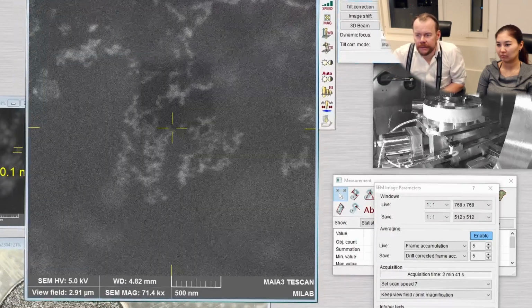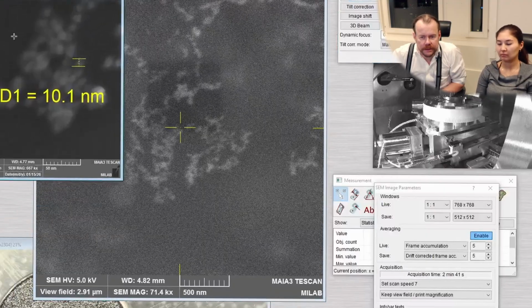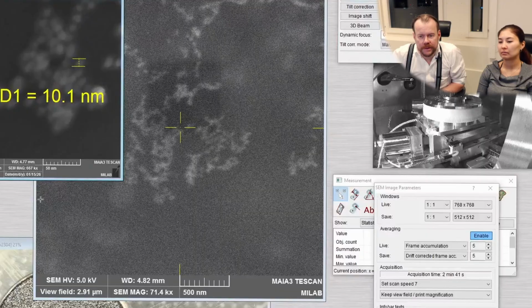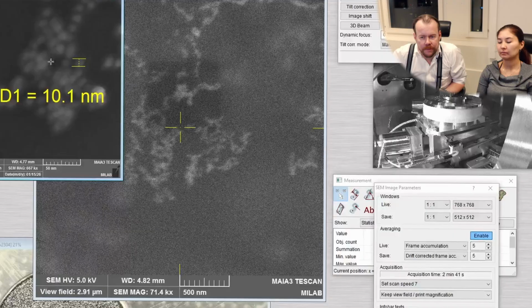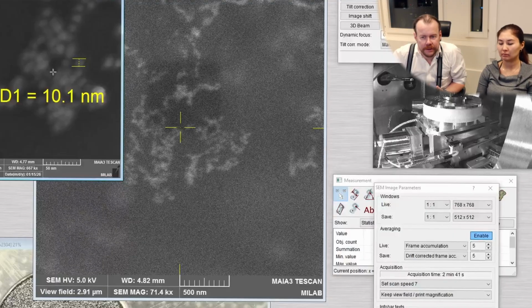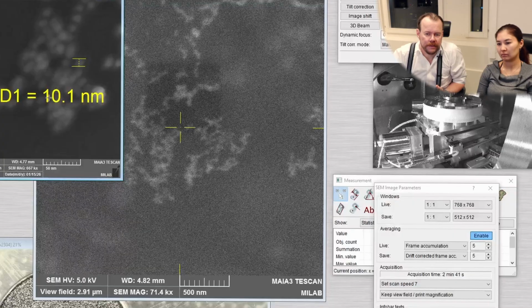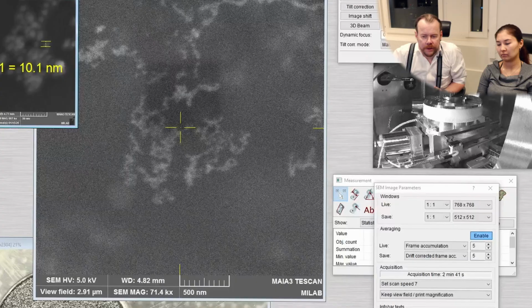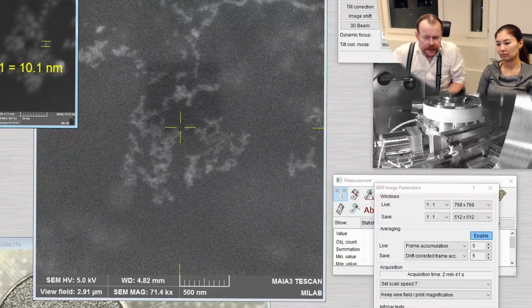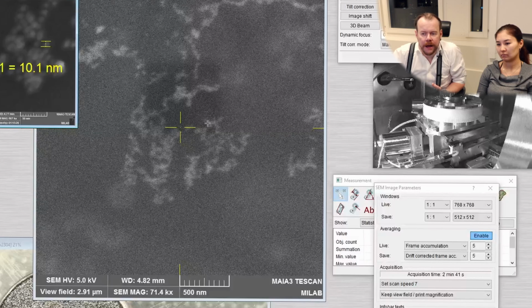Okay, but let's start from here. So we took this image on the grid that was facing upwards. So here we have the gold nanoparticles on top of the carbon film. And this was on 20 kV. And then we moved over to the grid that is flipped upside down. So that is the thing that we're monitoring right now.